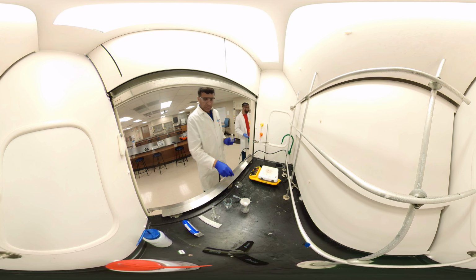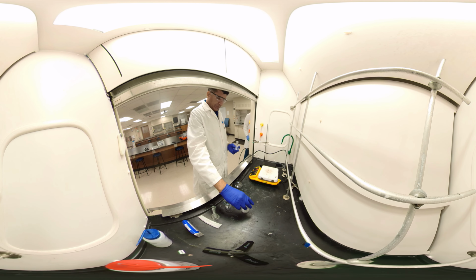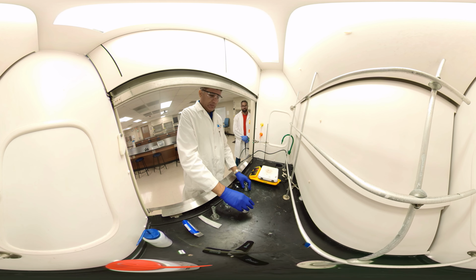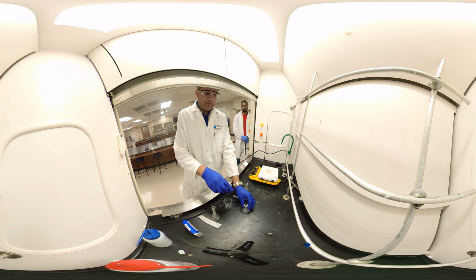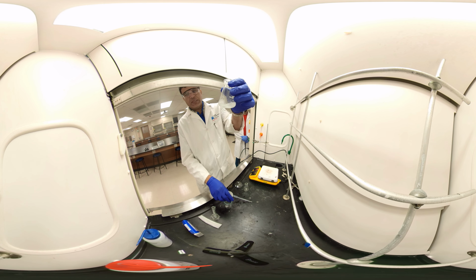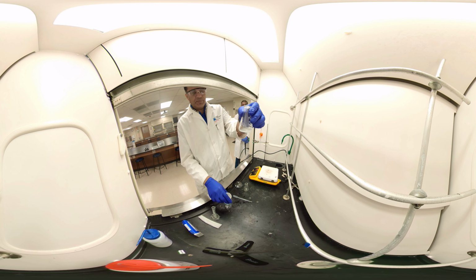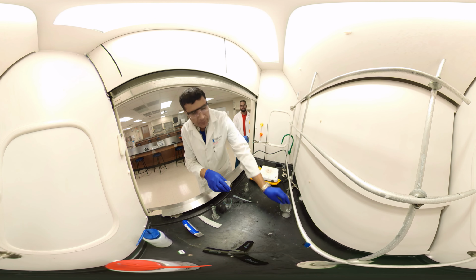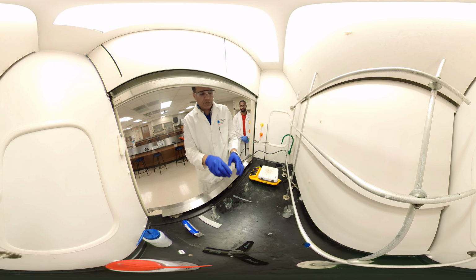And on the side, this one is the liquid filtered. It just came out. It has caffeine and aspirin. I put it on the side. That's my beaker 1. I cover it, otherwise it will evaporate.